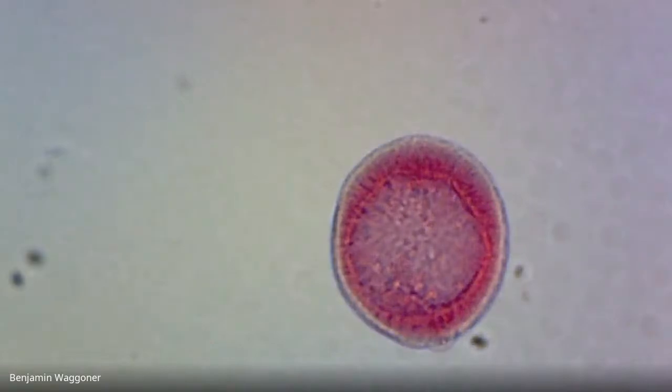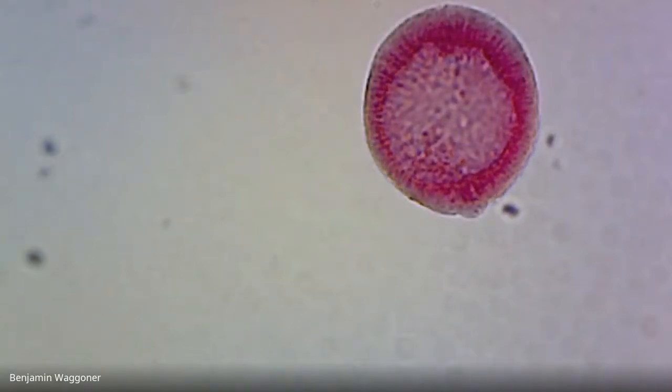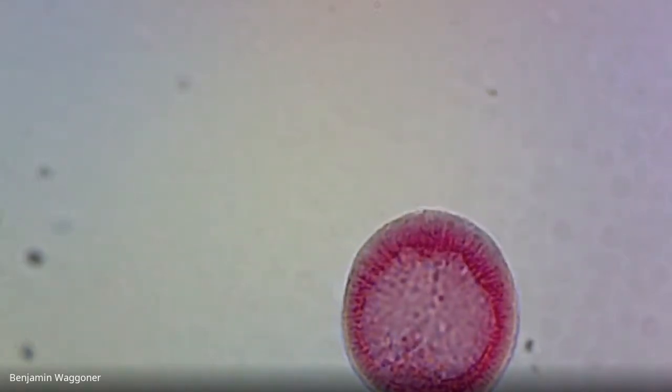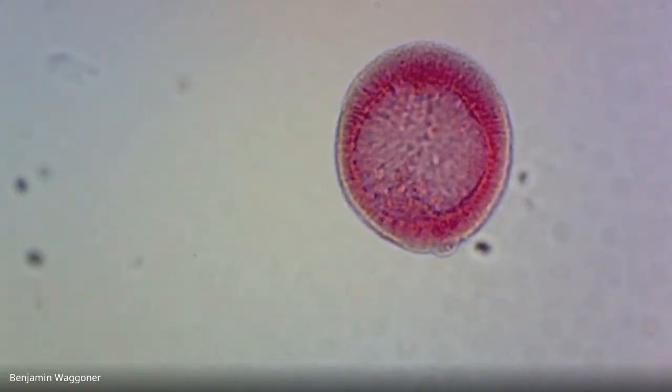Okay, there's another late blastula and maybe early gastrula, because I can convince myself that I can see just a few little cells down at about the 6 o'clock position that are beginning to migrate in. So this is the beginning of gastrulation, and let's look for a later one.